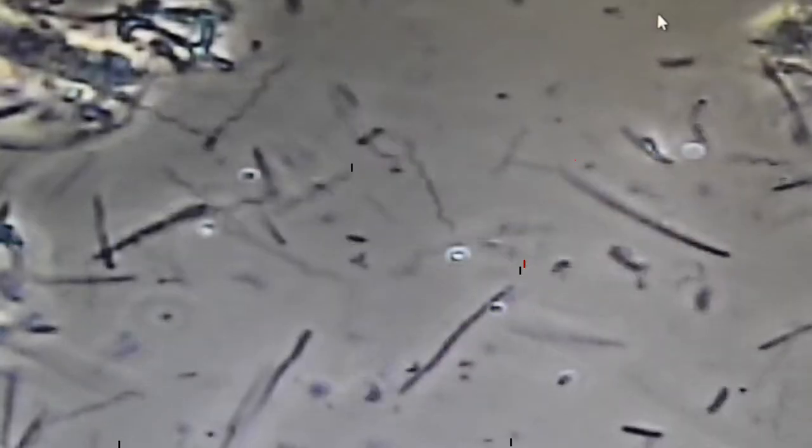This is a very active slide — a very significant periodontal infection in this patient. What you're seeing on the screen is a lot of motility. The thin corkscrew-like figures here are spirochetes. Spirochetes are an organism that should not be in plaque at all, and when we find them, it's a red flag that we've got some significant infection going on.